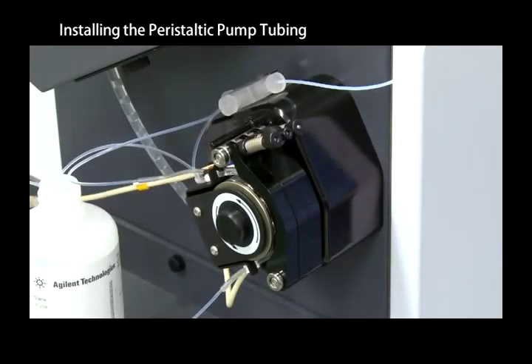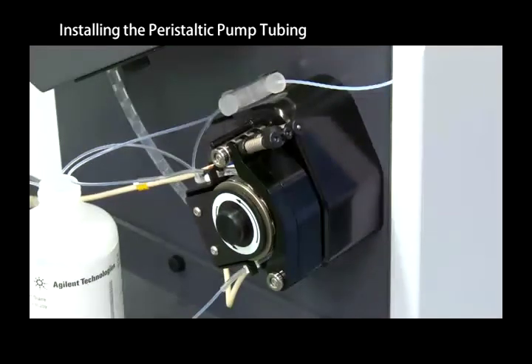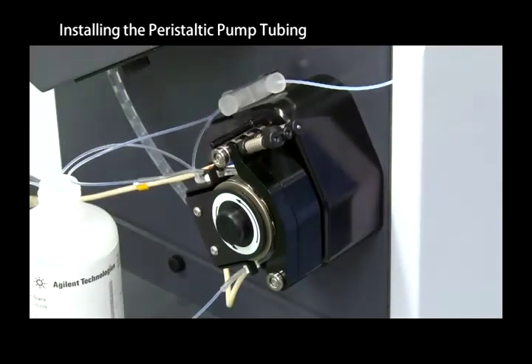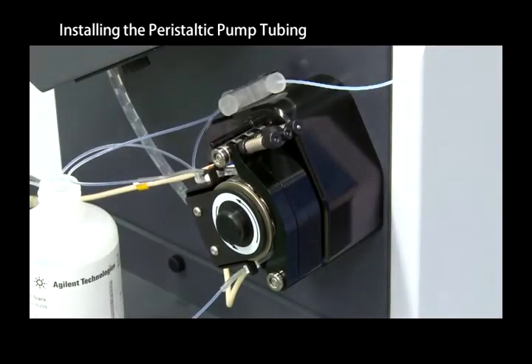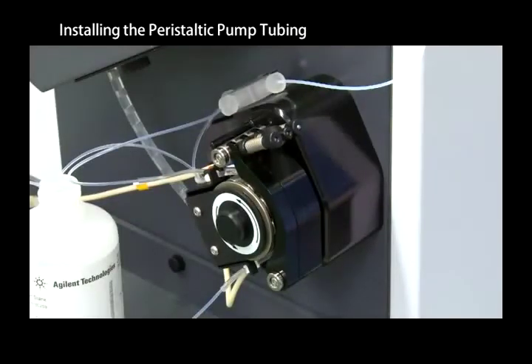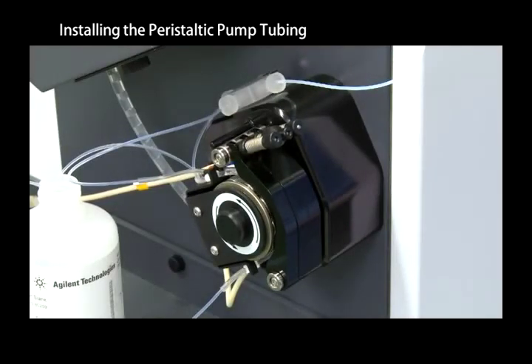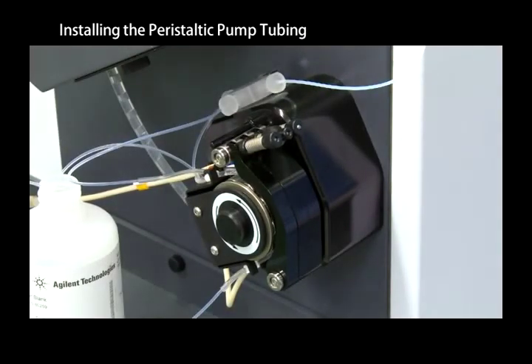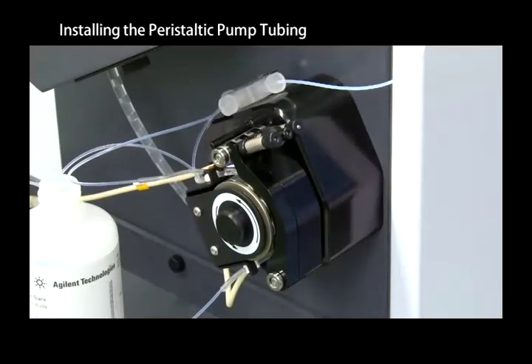In Analysis mode, check that pure water is reaching the nebulizer. Also check that excess water is draining from the spray chamber. Liquid and gas should be discharged alternately from the spray chamber.